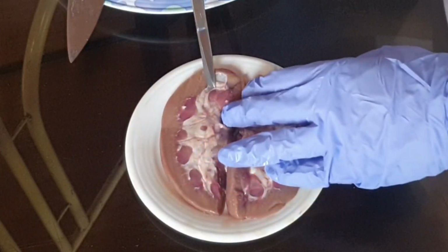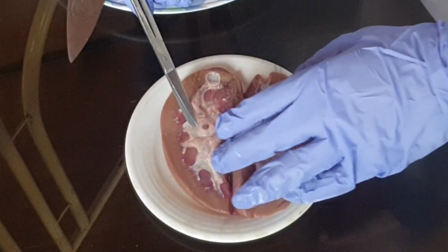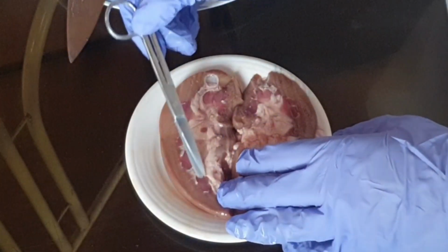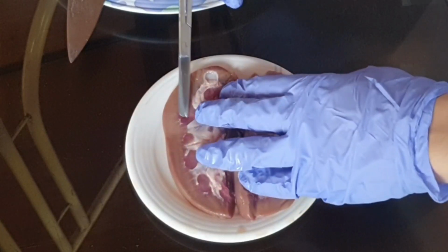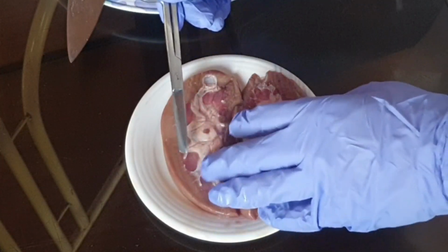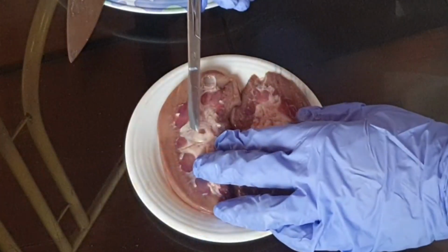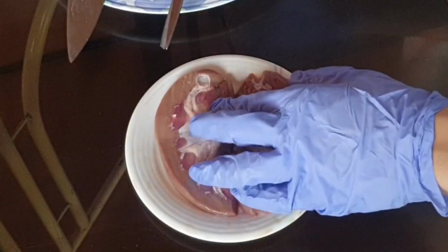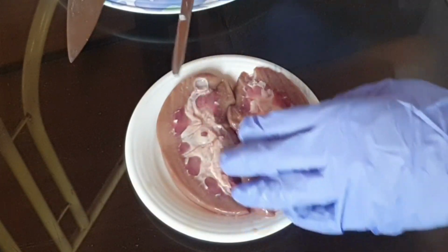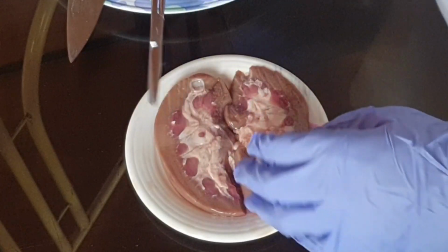The renal pyramids, because they are pyramid shaped. But when you count the renal cortex here, it is called the renal lobe. Okay, so this here in the middle of the renal pyramids is called the renal column. And then the channels here go down here. These are called the calyces, or the minor and major calyces.